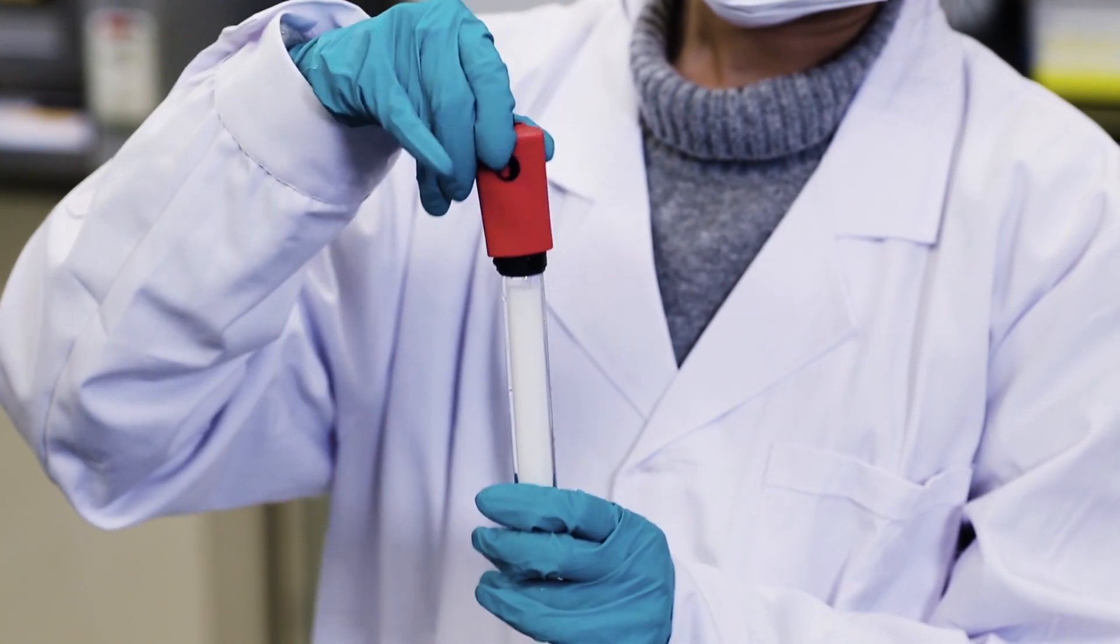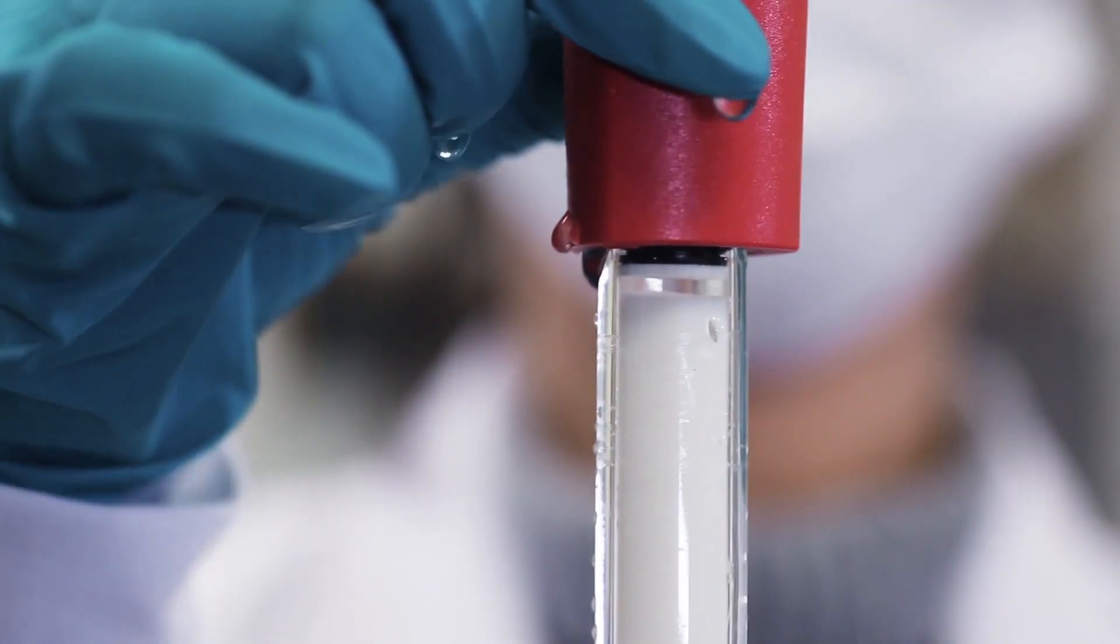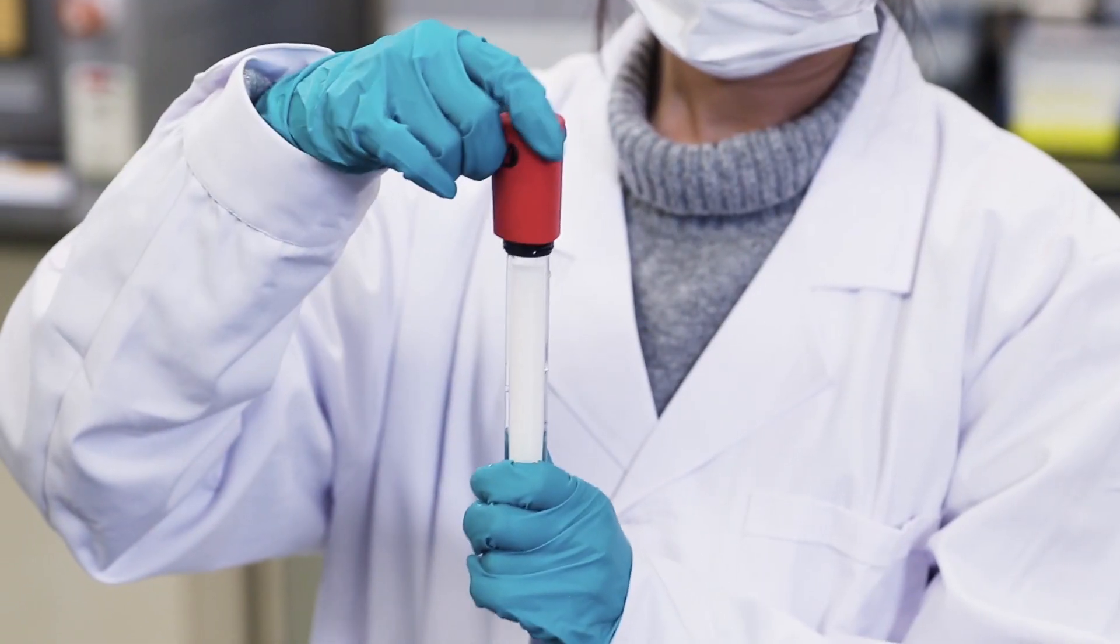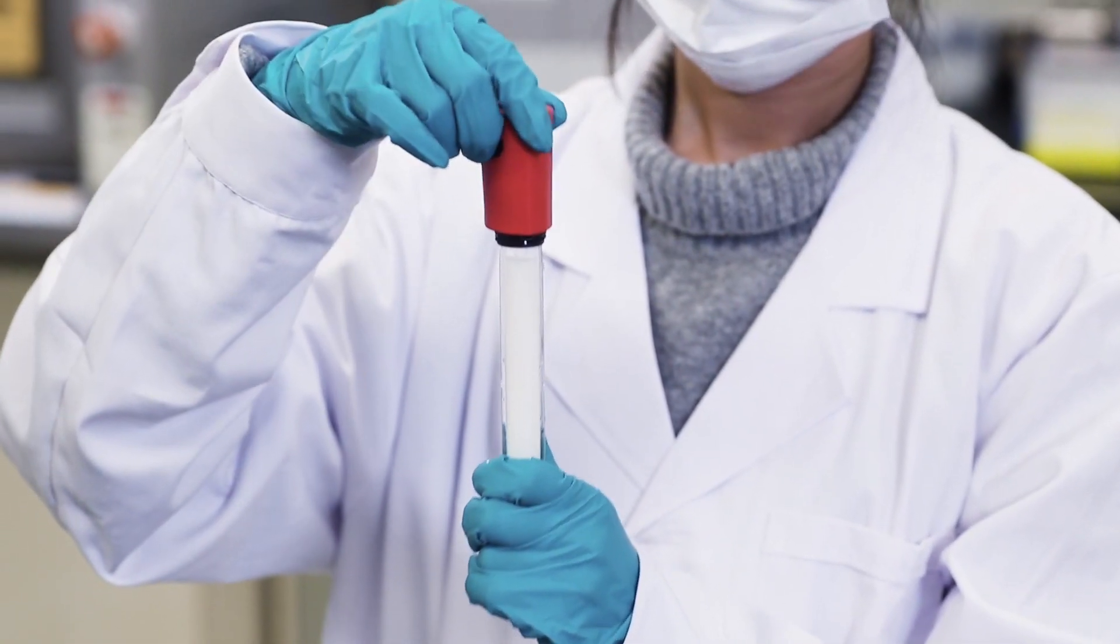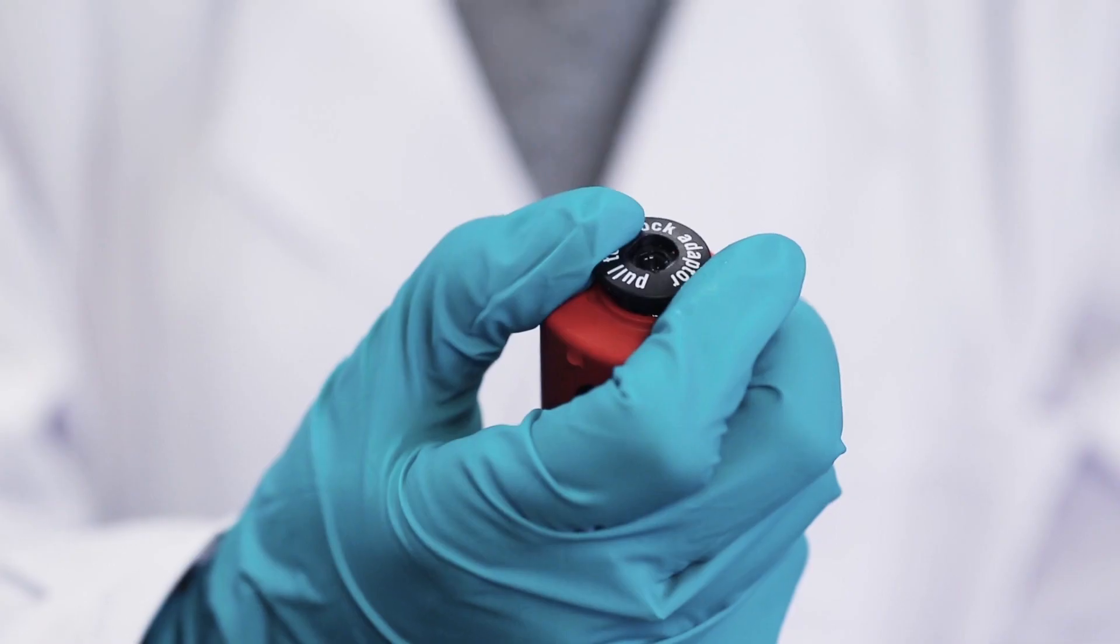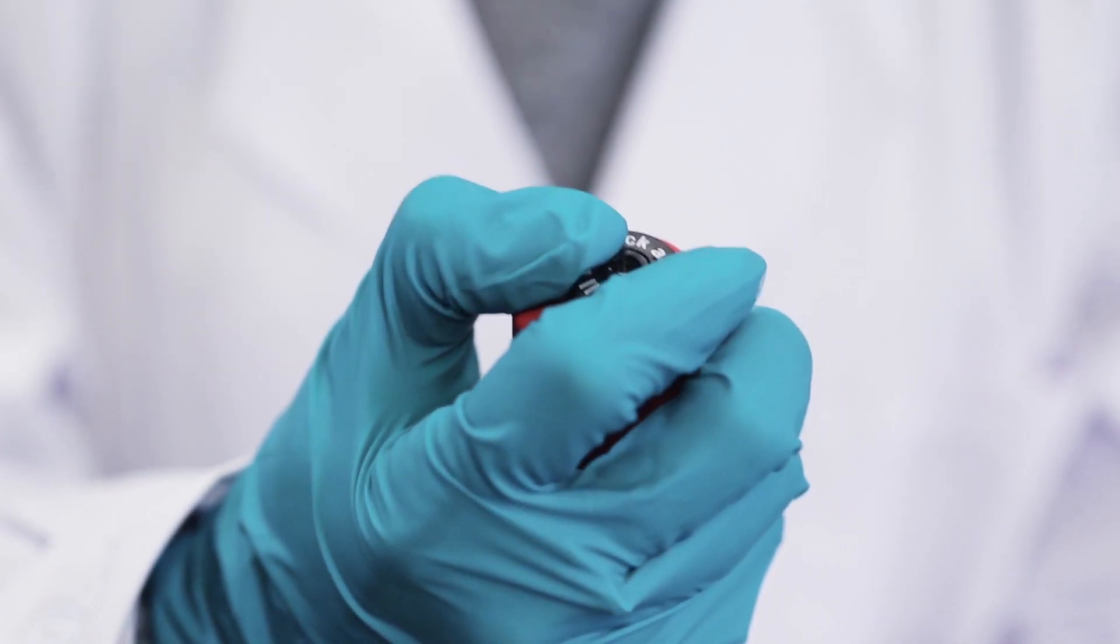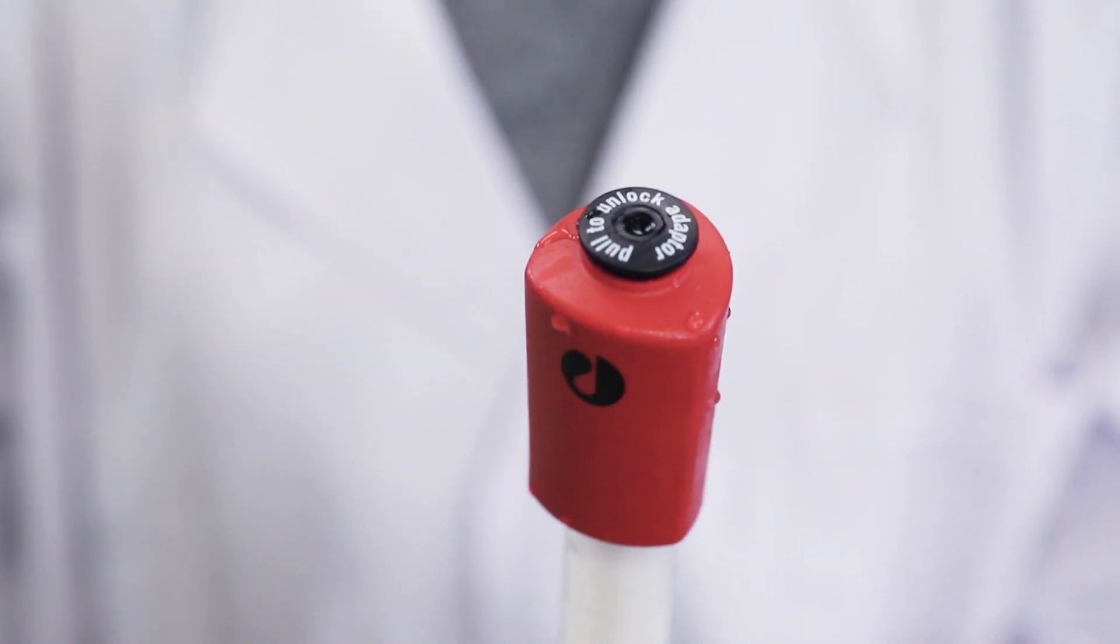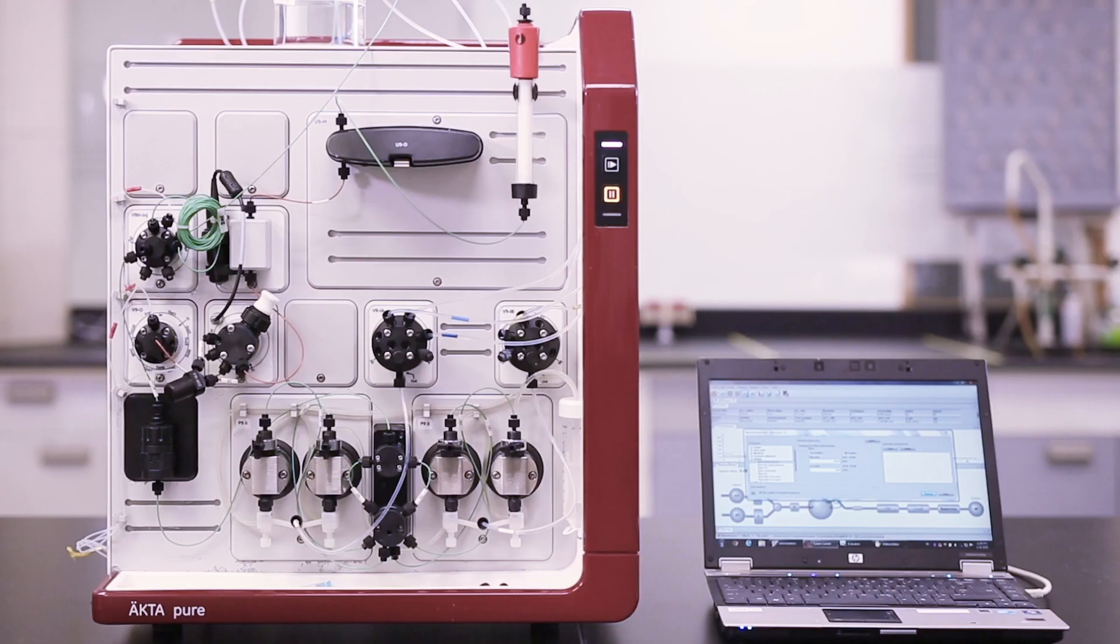Lay a clean wetted filter onto the top of the liquid surface. Insert the top adapter to the top of the column. Ensure that the inner part of the guiding rings fits into the slot on the tube threads. Liquid will be expelled out of the top as the adapter pushes the filter down to the surface of the resin. Add the locking ring to hold the adapter in place.